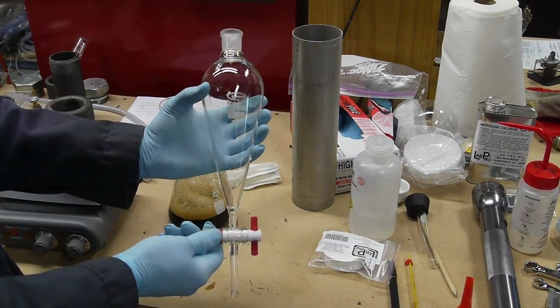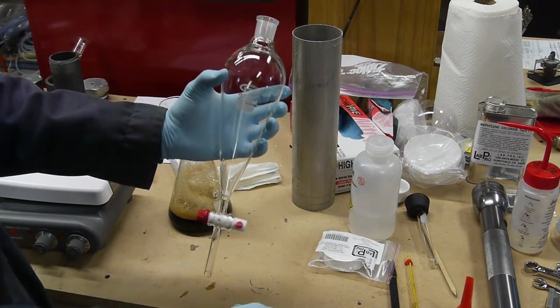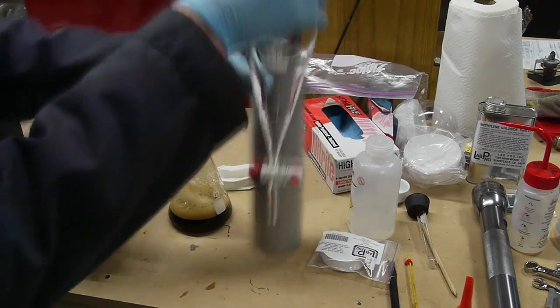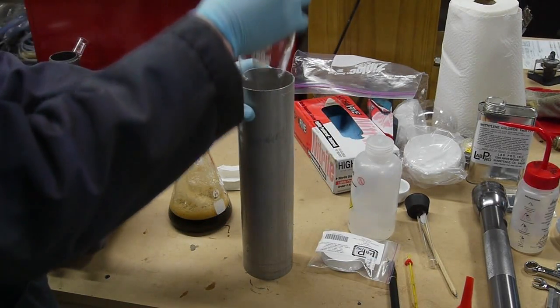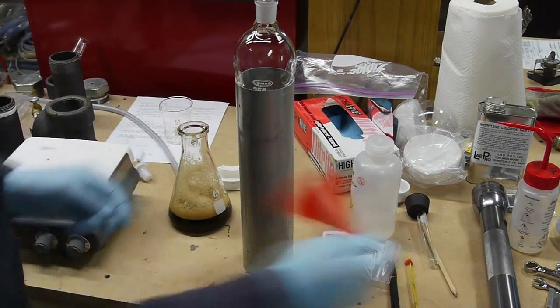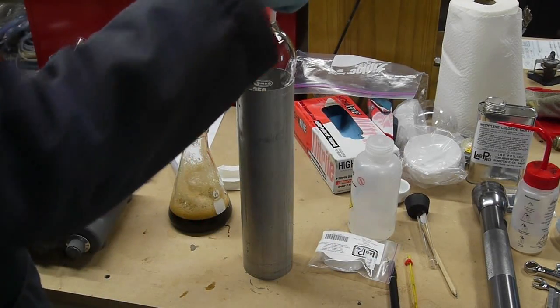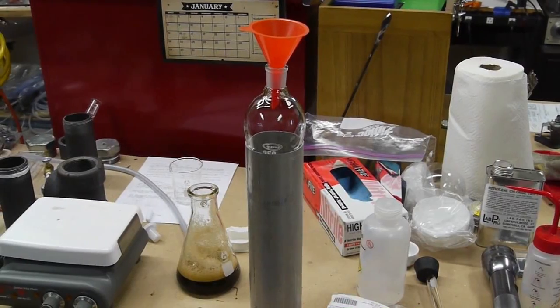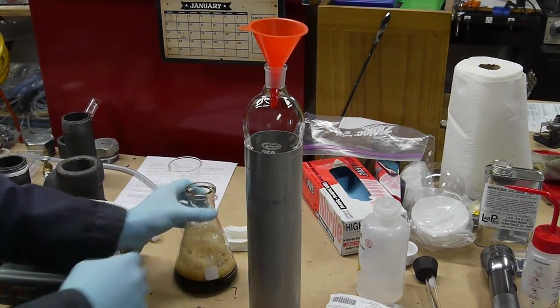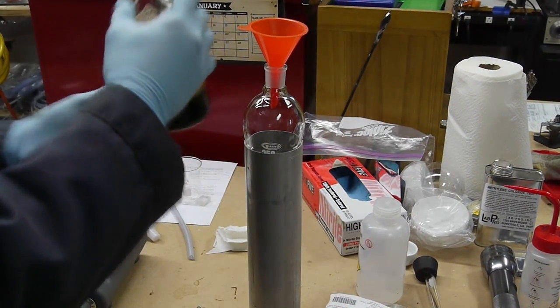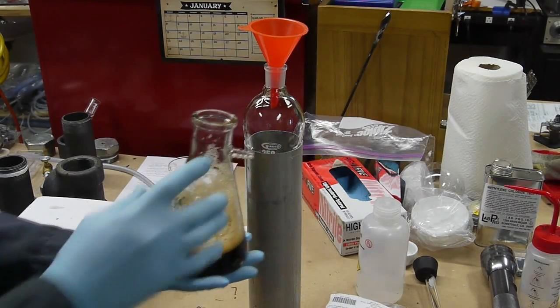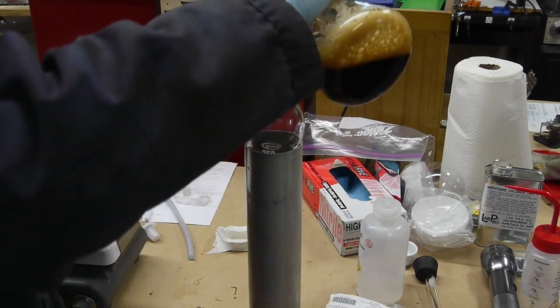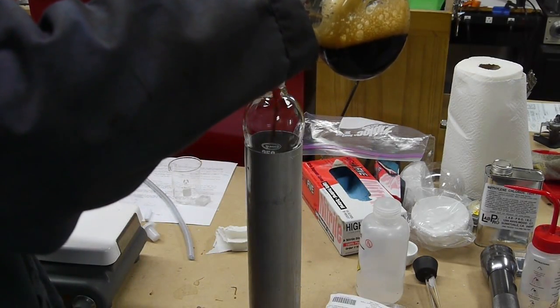So it should be possible to boil all that water away and be left with caffeine crystals in the bottom of the flask, but typically people don't do this. One, because it would take a long time to boil away all the water, and also when the water boils away, I think you're left with sort of a tarry substance, kind of a very sticky goo. The caffeine crystals don't form very well when they're boiled out of water - I'm kind of guessing a little bit here.